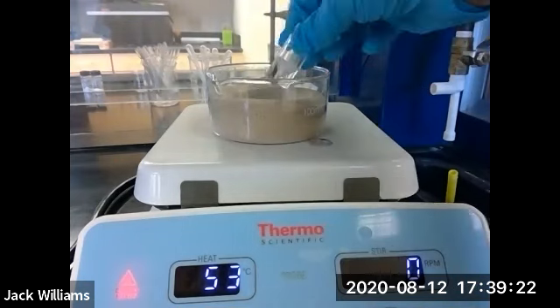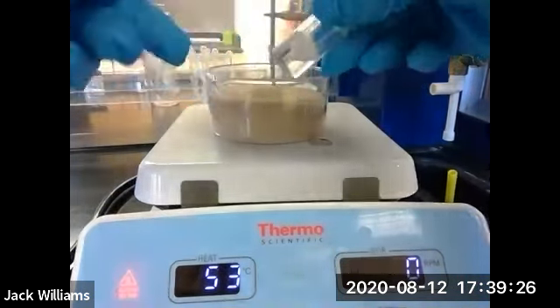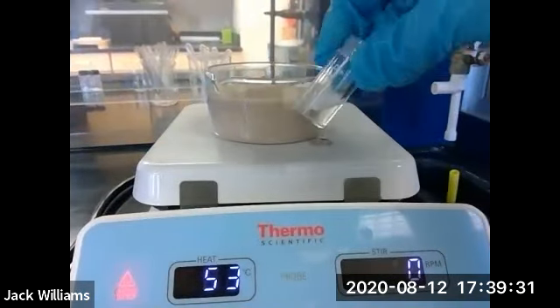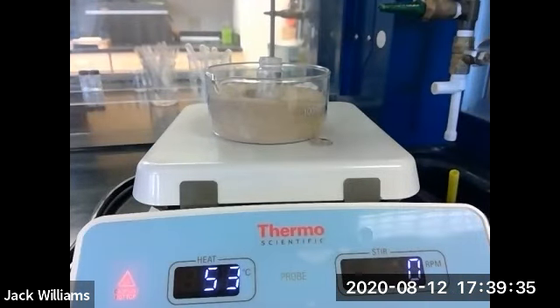And be careful when you weigh it, because if there's any sand clinging to this, right, then of course you're going to get an increase in the weight. So make sure you don't have any sand on there. But you're kind of drying to constant weight. You did that in general chemistry for one of the experiments. You had to heat something, weigh it, and heat it again. And then you heat it until you got a constant weight. So it's a similar type of technique.